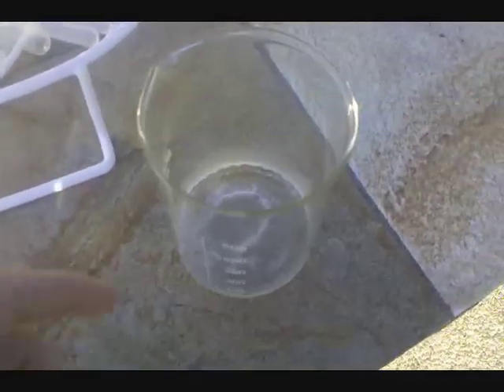And here we are — finished product. I've let it sit for a few days to dry, and you can see there is still some wet caffeine there in the middle, but you can see crystals of caffeine that crystallized out of the solution. I'll be scraping this off and sealing it in an ampoule just as a sample.